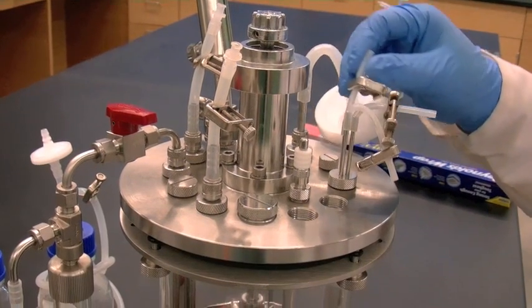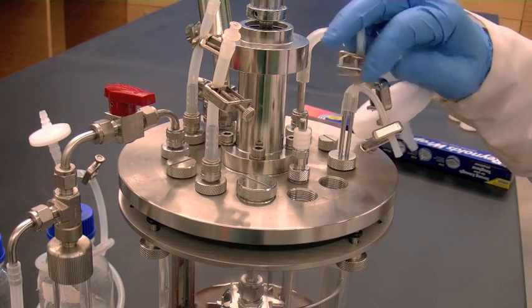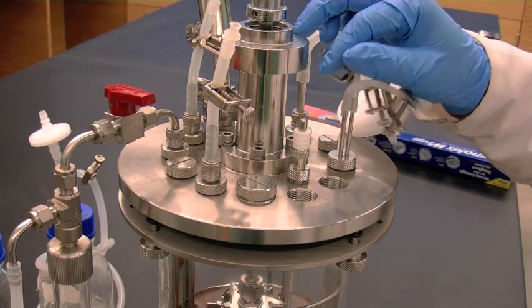Clamp off the air sparger tube. Clamp off all tubes that have penetrations which go below the internal liquid level to prevent boiling over during autoclaving.